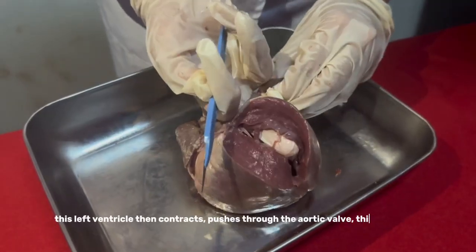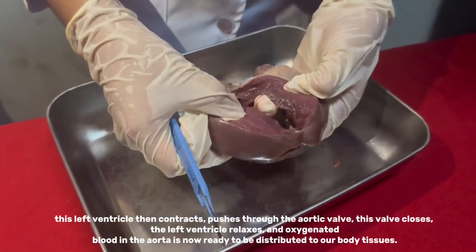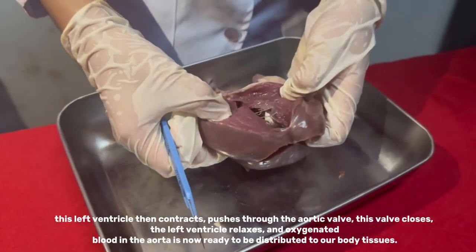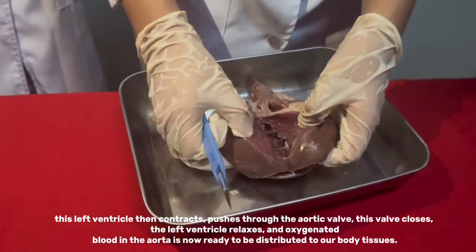This left ventricle then contracts and pushes blood through the aortic valve. This valve closes, the left ventricle relaxes, and oxygenated blood in the aorta is now ready to be distributed to our body tissues.